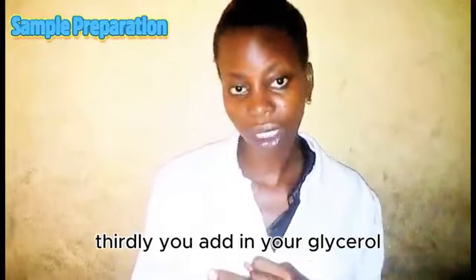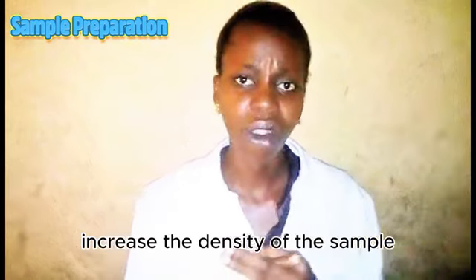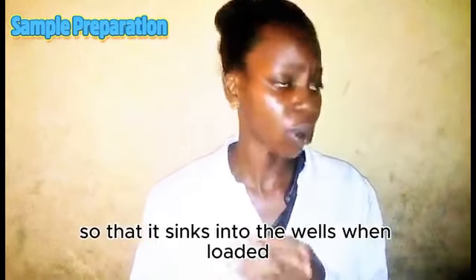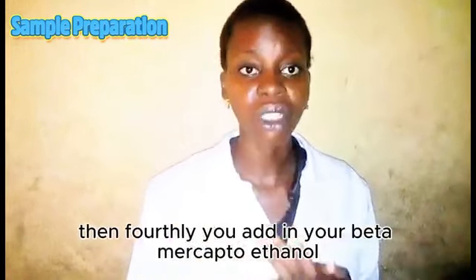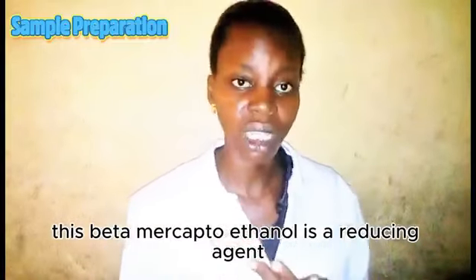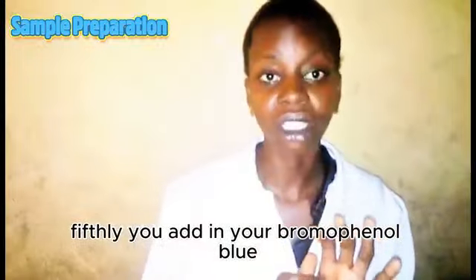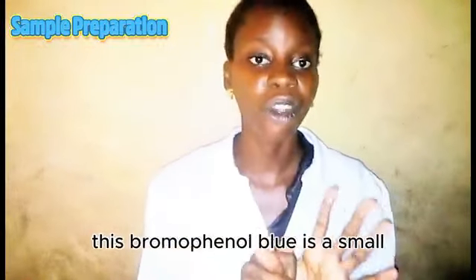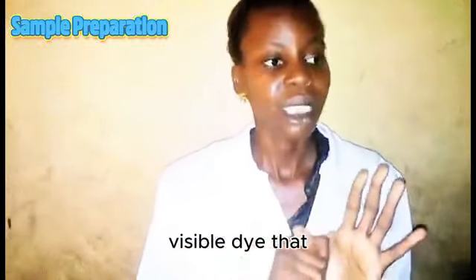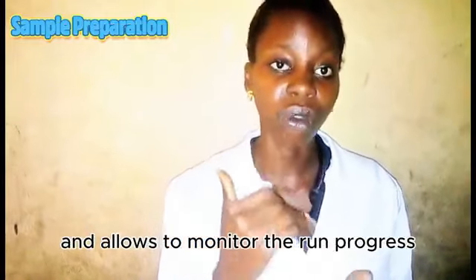Thirdly, you add in your glycerol. The glycerol's work in this is to increase the density of the sample so that it sinks into the wells when loaded. Then fourthly, you add in your beta-mercaptoethanol. This beta-mercaptoethanol is a reducing agent that helps to break the protein's disulfide bonds. Fifthly, you add in your bromophenol blue. This bromophenol blue is a small visible dye that moves ahead of the proteins and allows you to monitor the run progress.